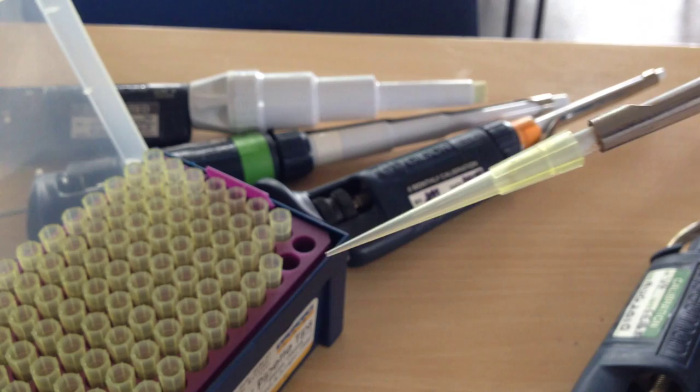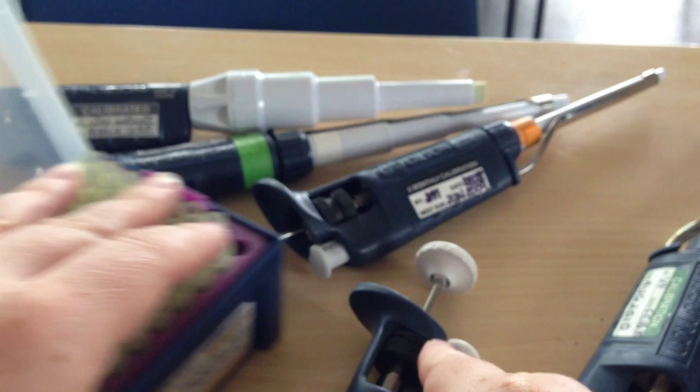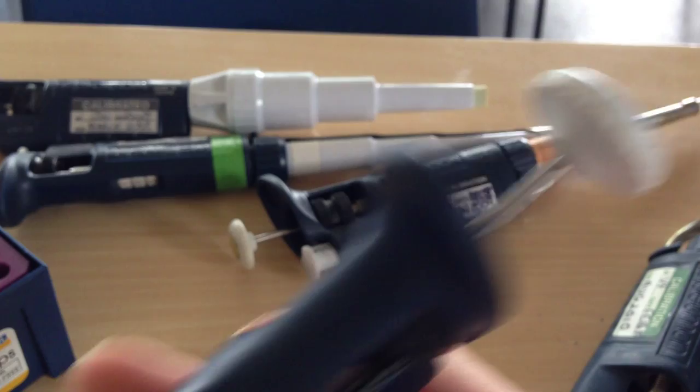Now some schools are likely to reuse tips because they don't have very many of them. Some schools are fine with you just throwing tips away.